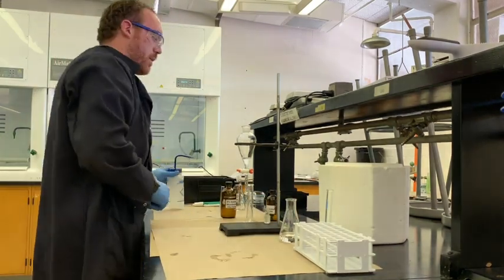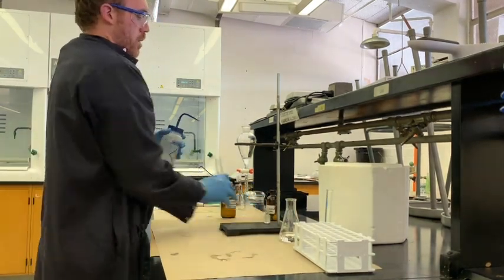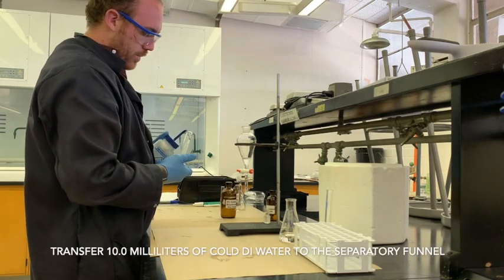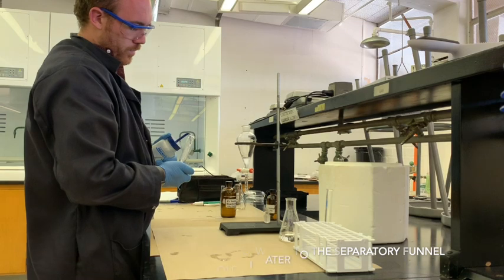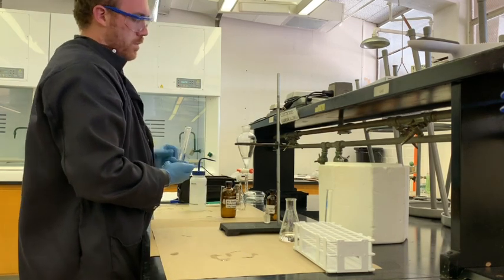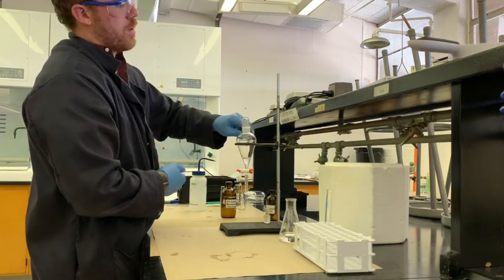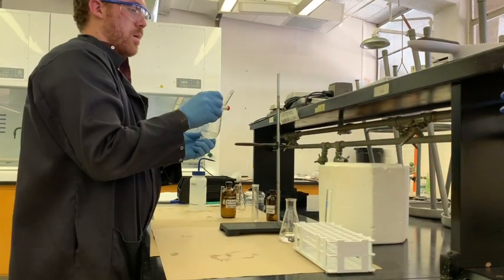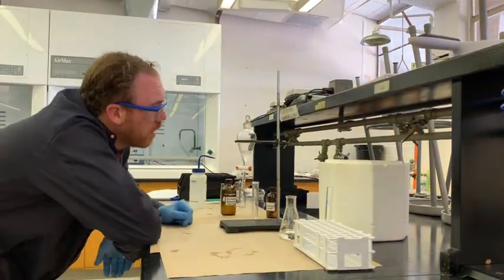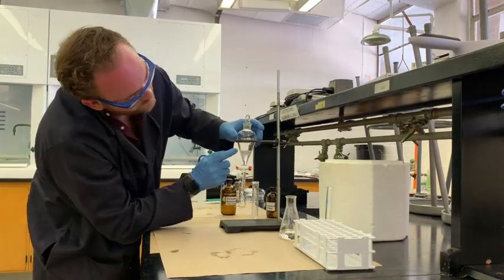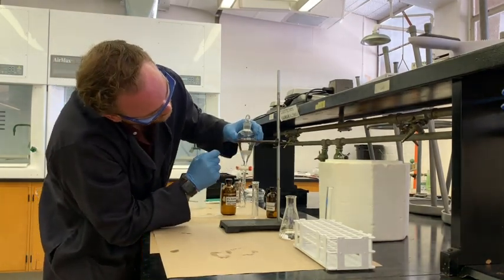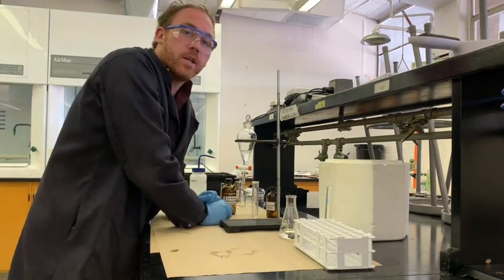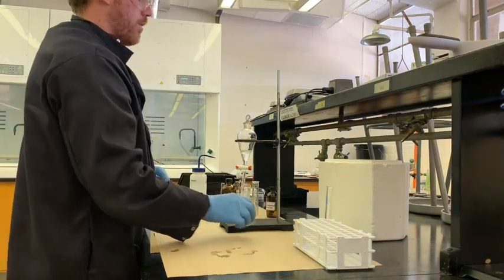And the last portion is just going to be a little bit more water. I'm going to take another 10 milliliters and pour it into our separatory funnel. You begin to see the layers separate. And once they've separated, you're ready to pour off the aqueous portion.